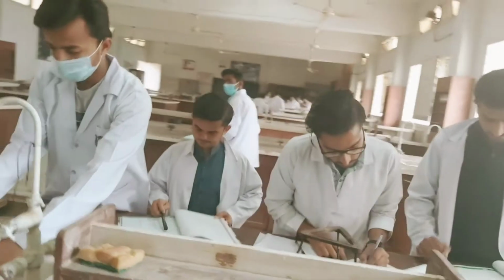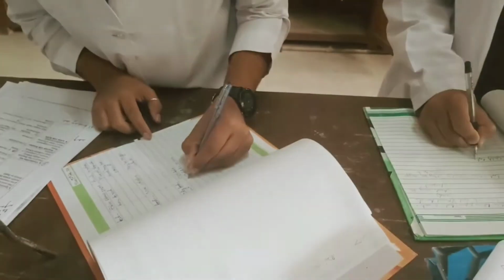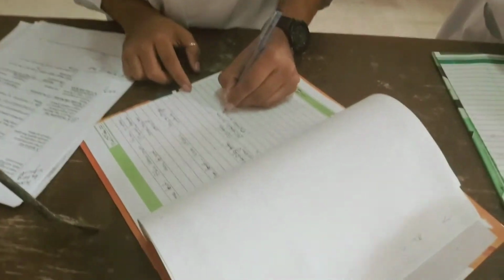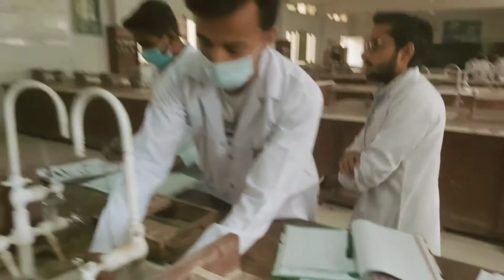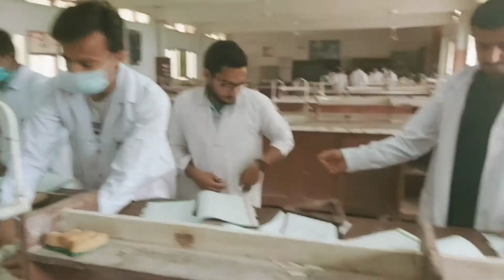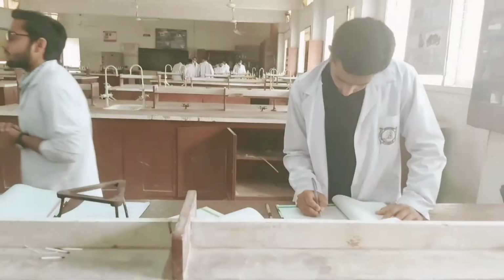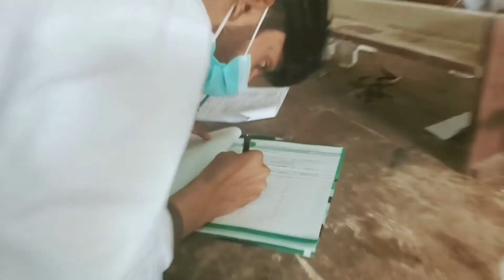This is how students are supposed to work. They have to experiment and they have to record their findings. This is how they are doing it, recording their findings directly in the journal. No rough work. They have to put their data directly in their journals. This is what I have trained them to do. And this is a very smart group and they are doing it nicely, properly. They are working like perfect chemists. They have their schemes and their journals only on the desks.